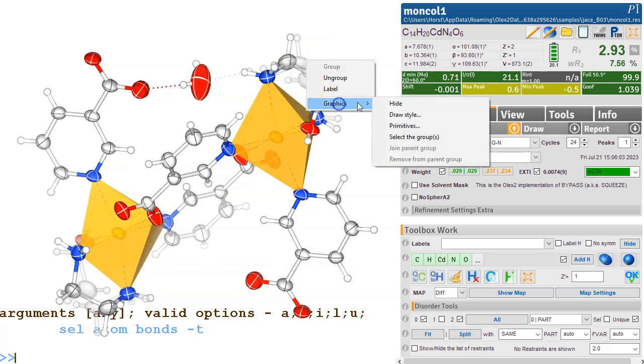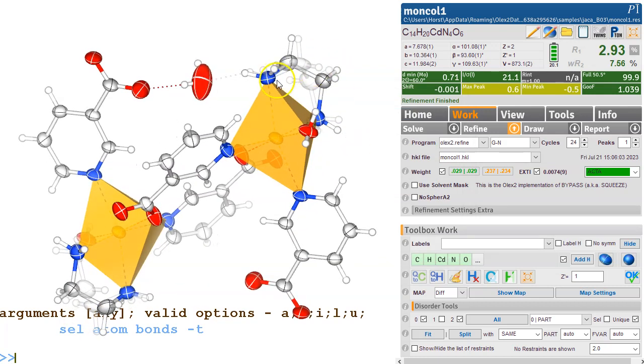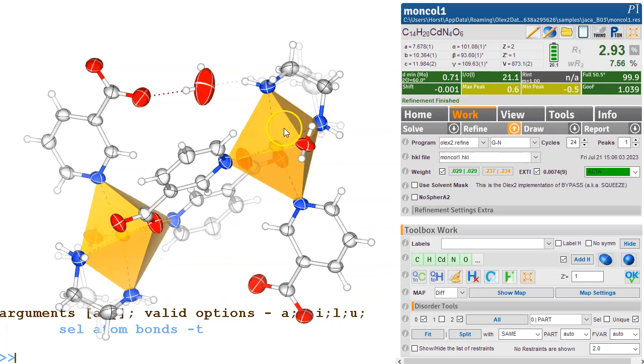Let's try this again. I'm changing the draw style, and I'm also putting on the blending. I don't remember which way it runs, either 80 or 20, but with gray we won't see. So the original color of the atom shines through. So this now looks pretty good to me. And if this was a nitrogen or oxygen, you would still just about see this. So this name is now remembered. So the next time you want to use this, you just go group -n equals P2 for part 2. And you will have your style for making a picture.